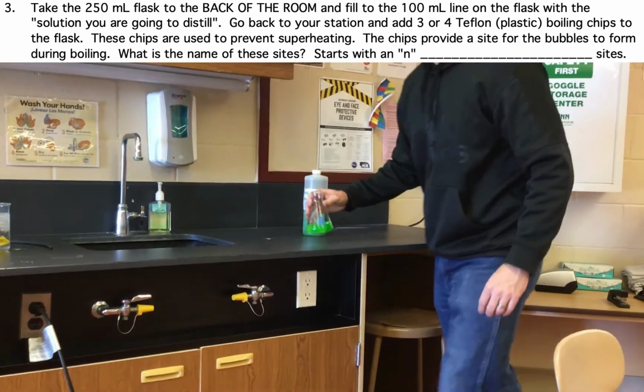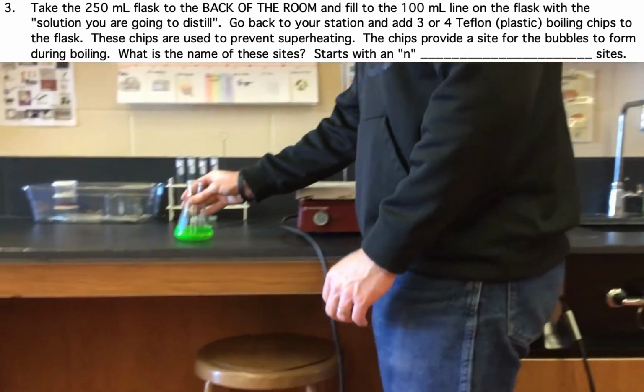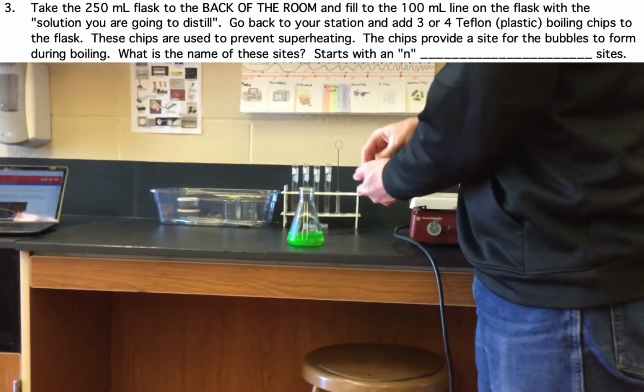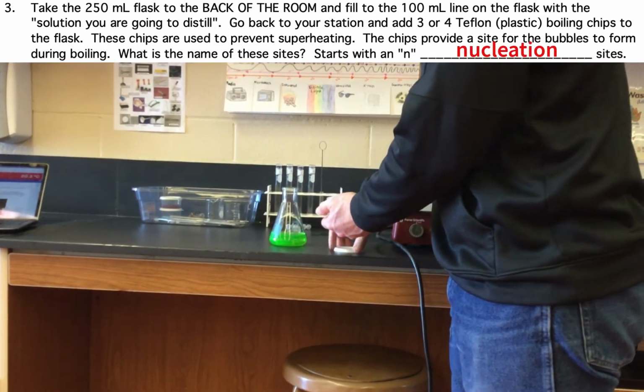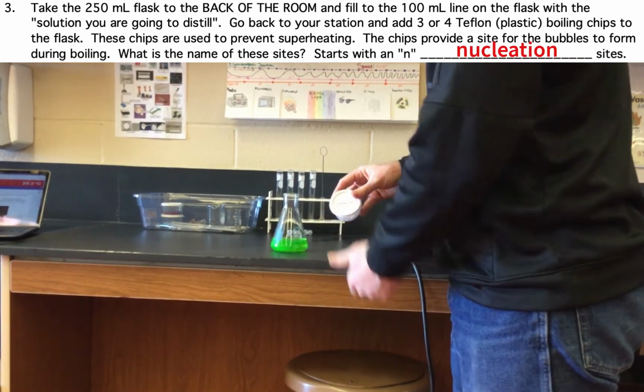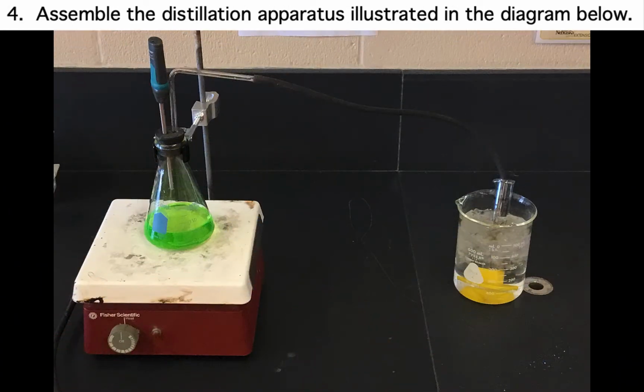Now I'm going to add boiling chips to the solution in the flask. These boiling chips help prevent superheating and provide nucleation sites, or places where bubbles can form when the solution boils. The apparatus is now set up and we are ready to begin our distillation.